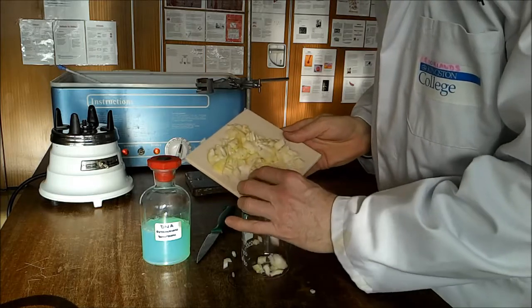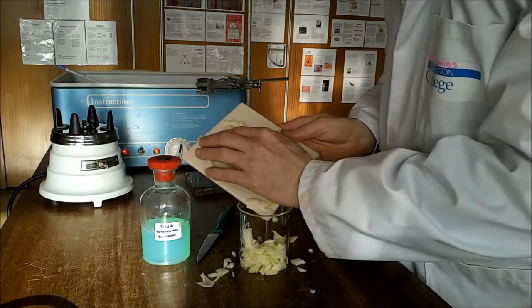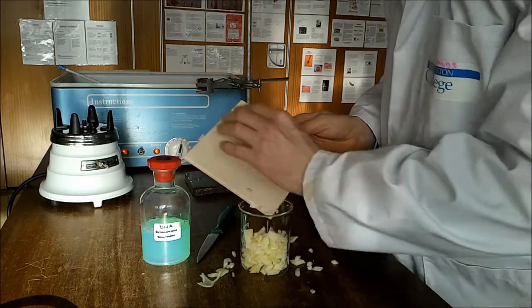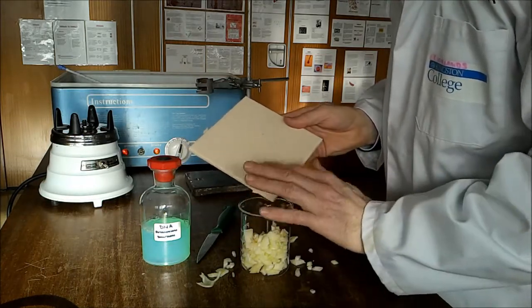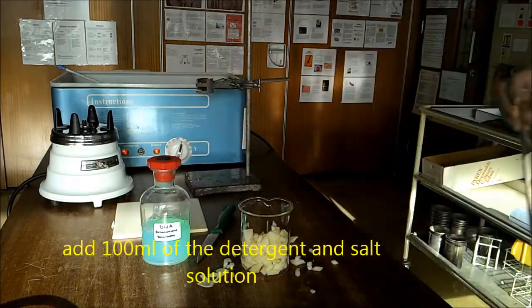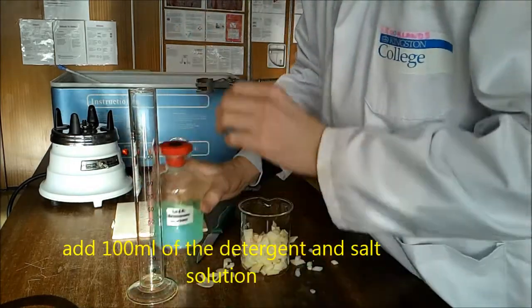I'm going to pour it in a beaker and top it up to 100ml.